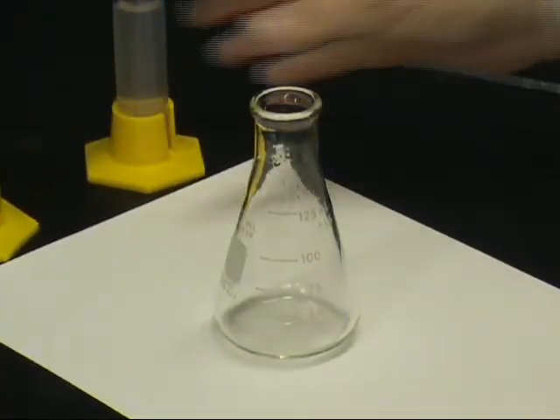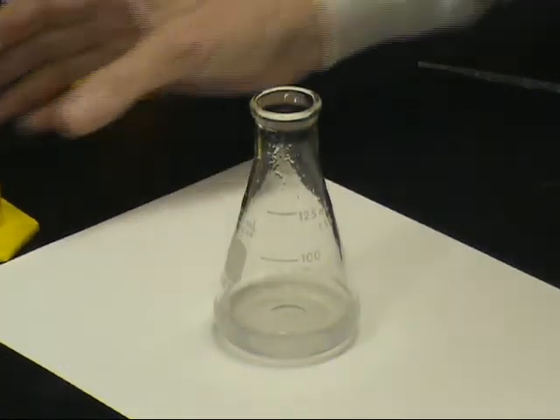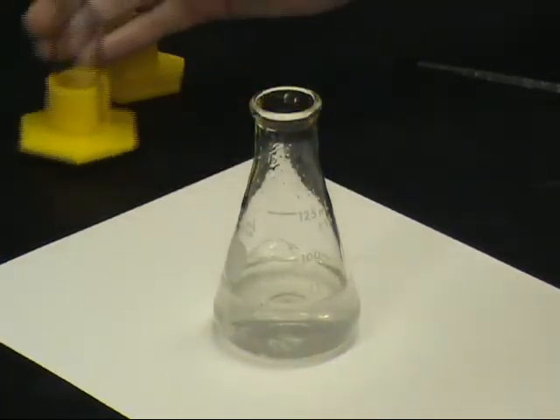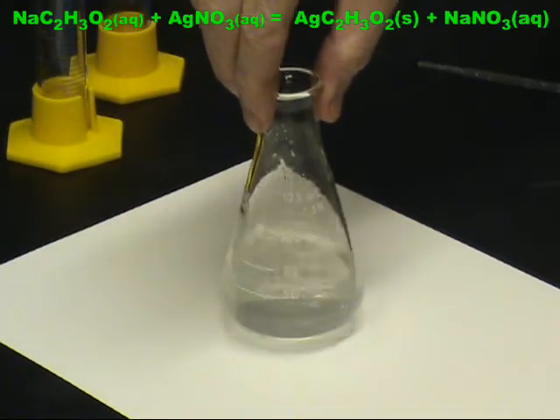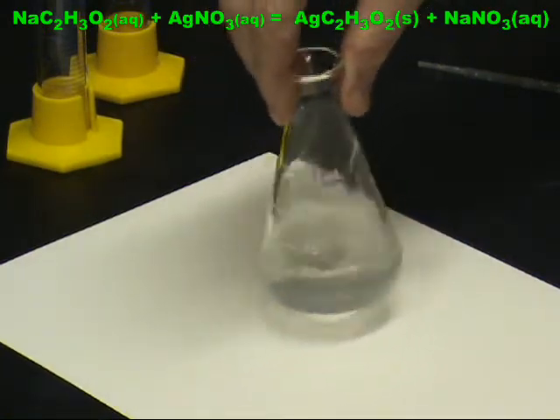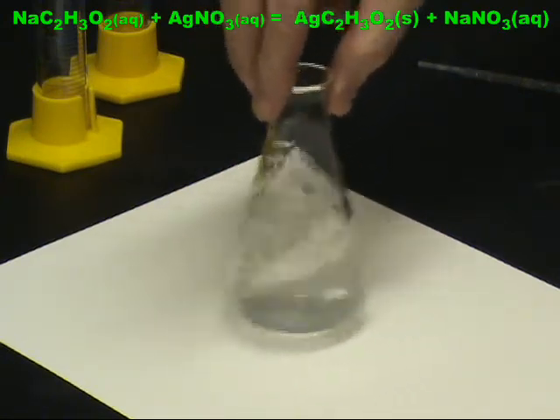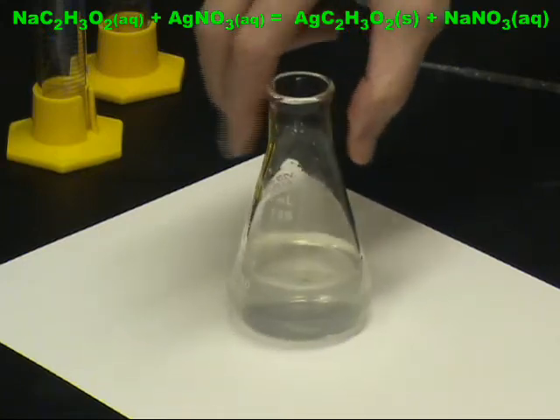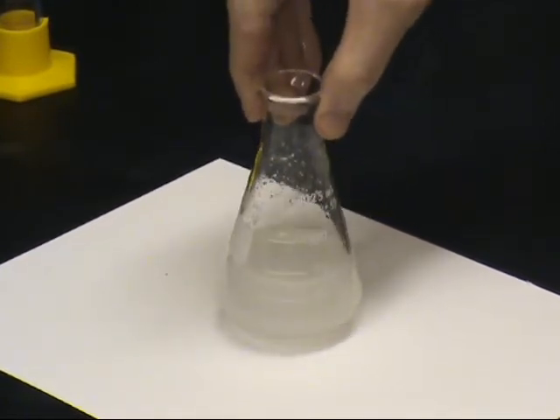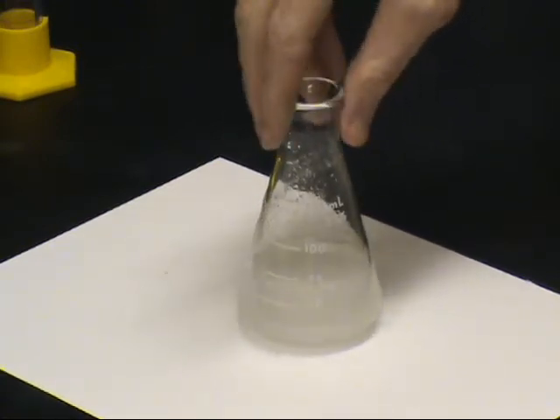Next, these solutions are poured into a 125 or 250 ml flask, and the resulting solution is shaken vigorously. While sodium acetate and silver nitrate are both soluble solids, once the solutions are mixed, the silver ion comes into contact with the acetate ion. Silver acetate is a sparingly soluble salt and soon begins to precipitate out of solution. The solution is shaken every 5 minutes for a period of 20 minutes to ensure precipitation of the silver acetate is complete.